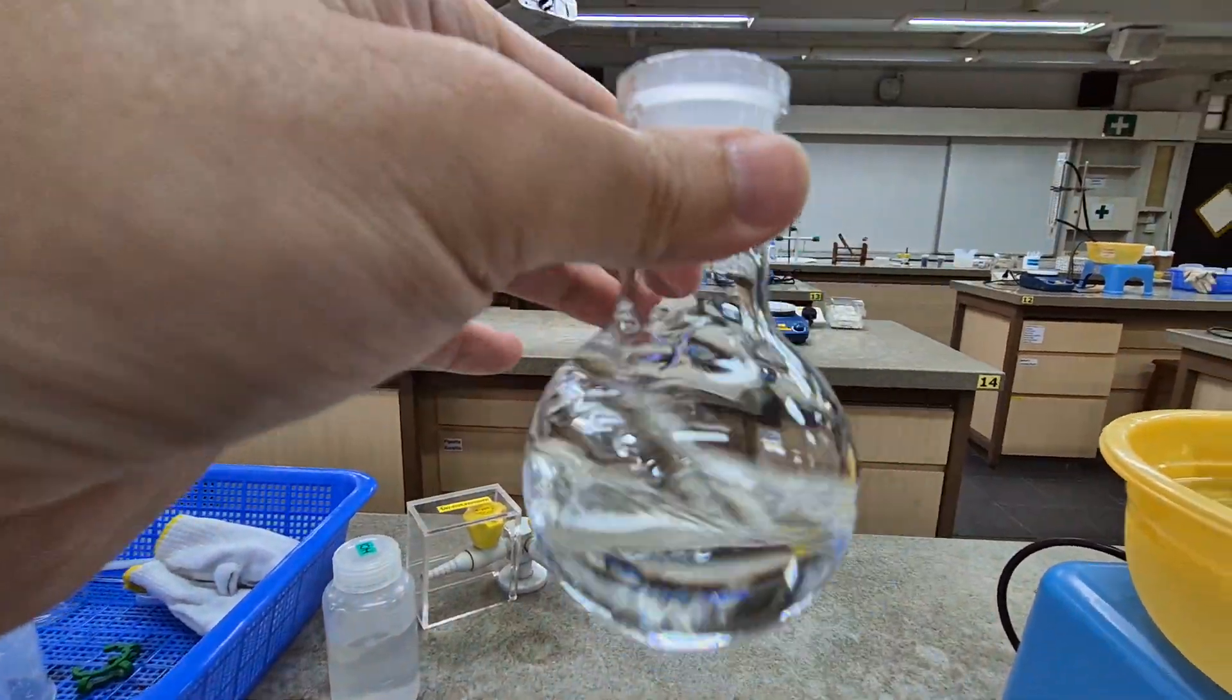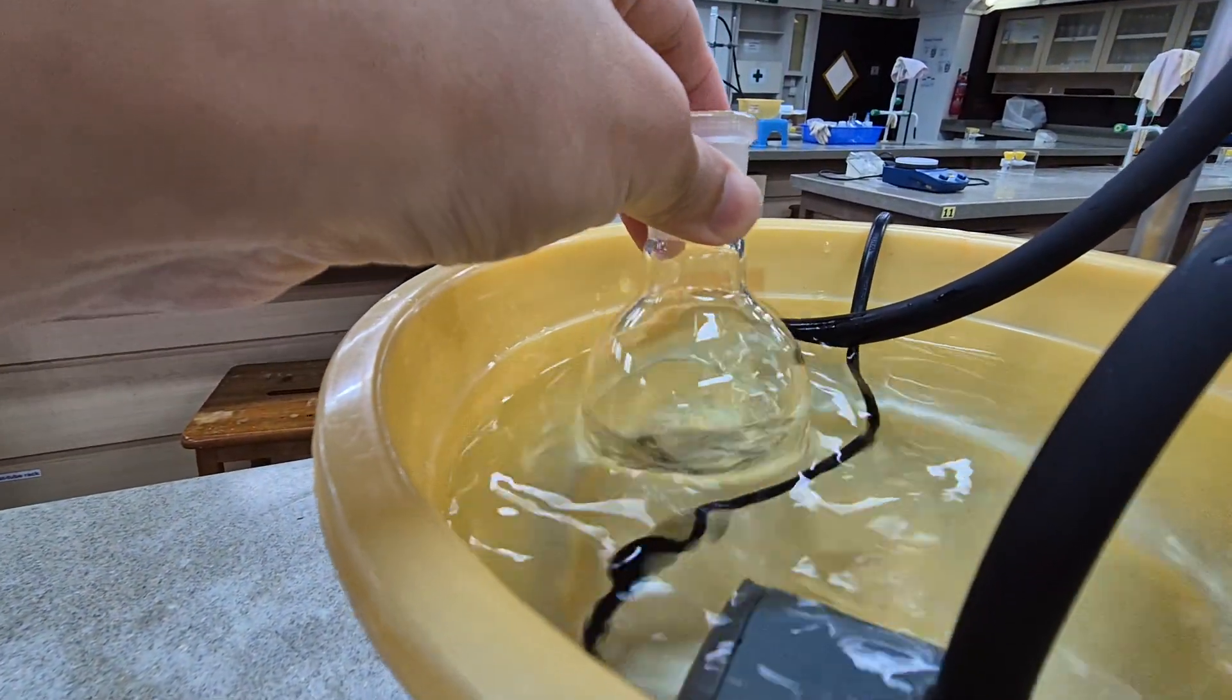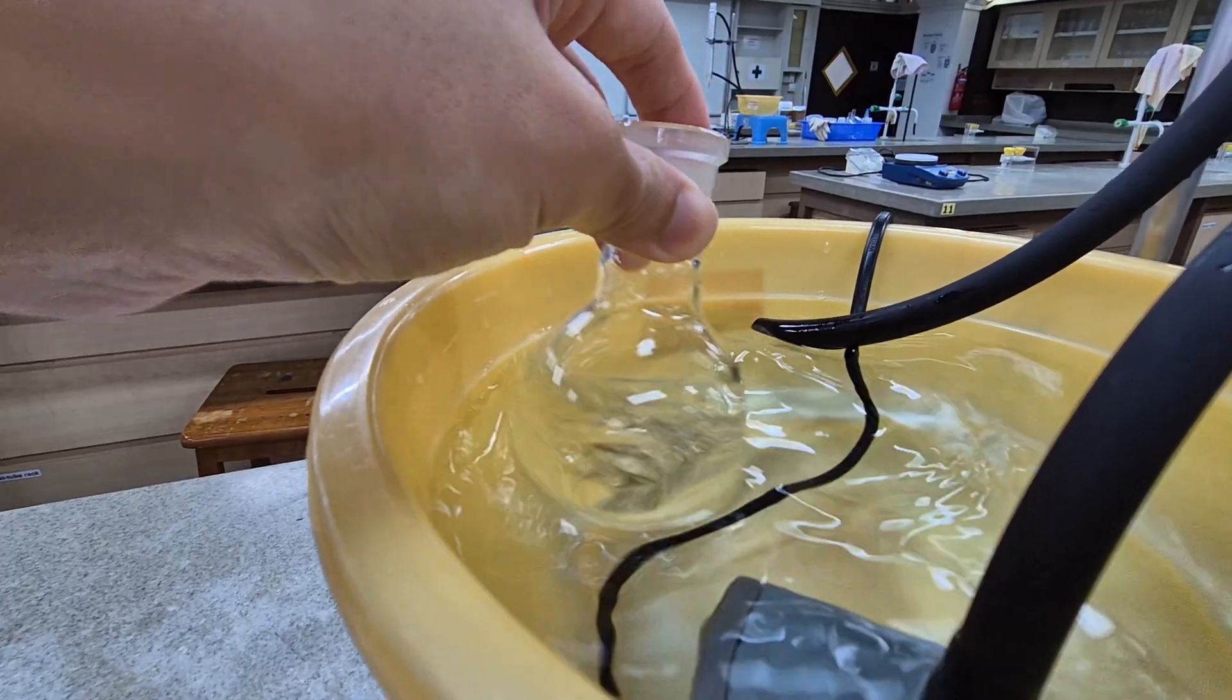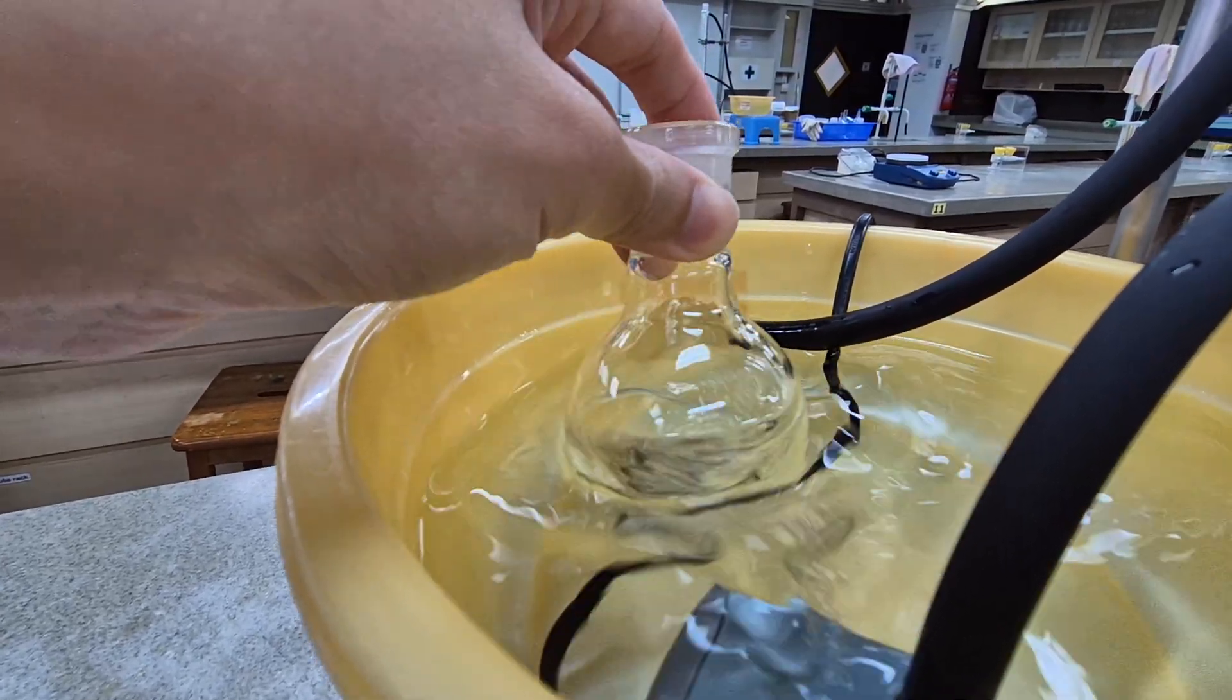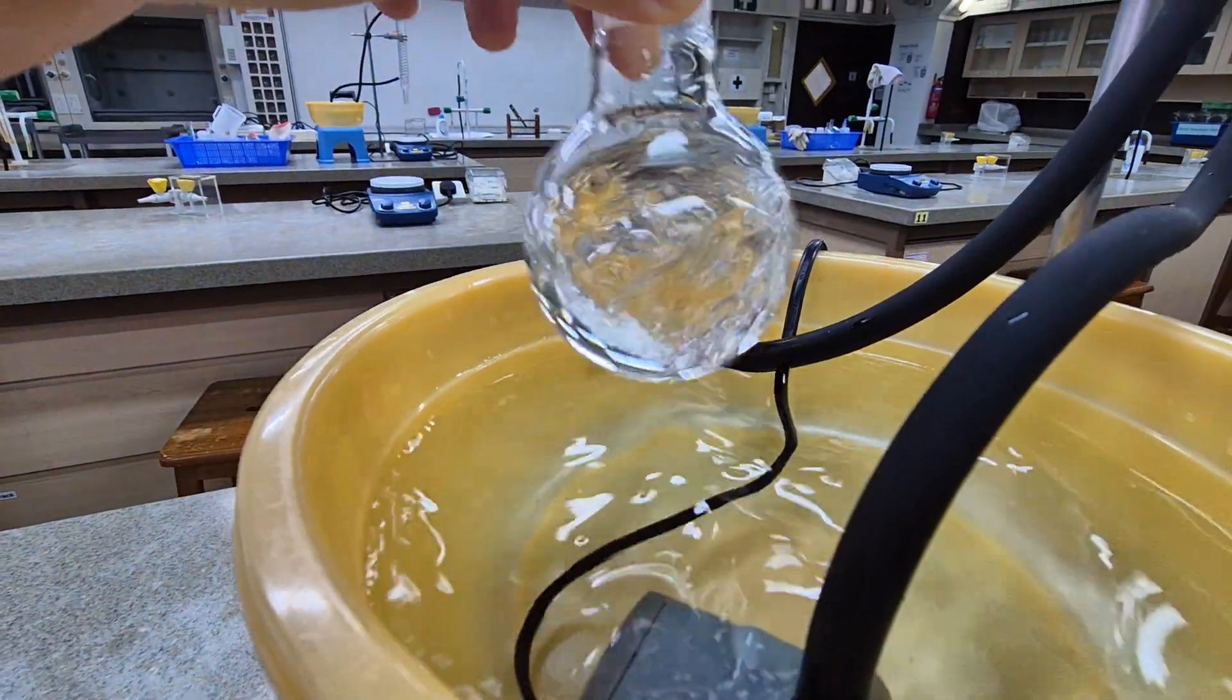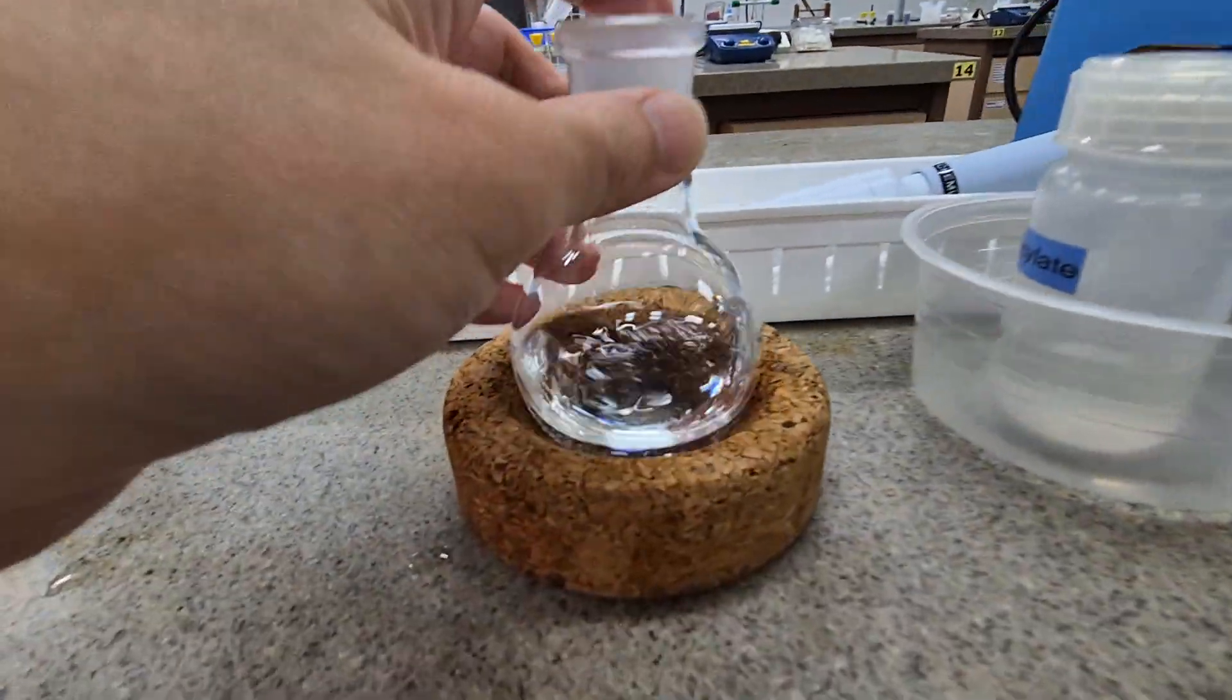If I cool this, you'll notice that the white precipitate will appear very quickly. It's not necessary, but I think in our case here it'll be good as a form of validation of what is the chemistry involved. Just going to let it cool for a while.